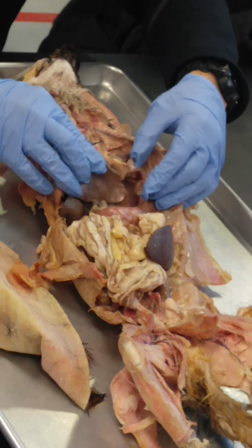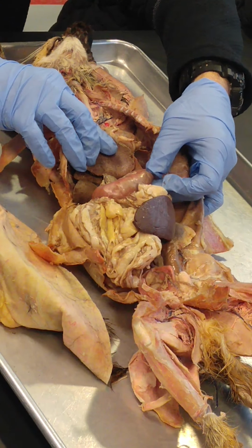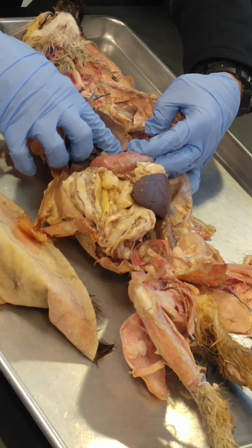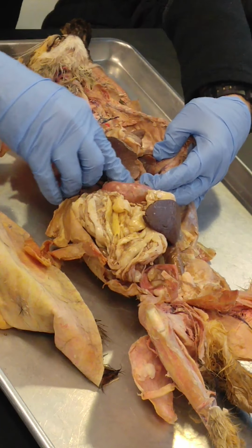Stomach. All right, so below the liver is the stomach. So this is the stomach right here. Esophagus will tie into that, but that's the stomach. So on the stomach, we've got the cardiac region, or cardia. It's where the esophagus ties into the stomach. So the cardiac region is where, I'll say it again, the esophagus ties into the stomach. That would be this region here.